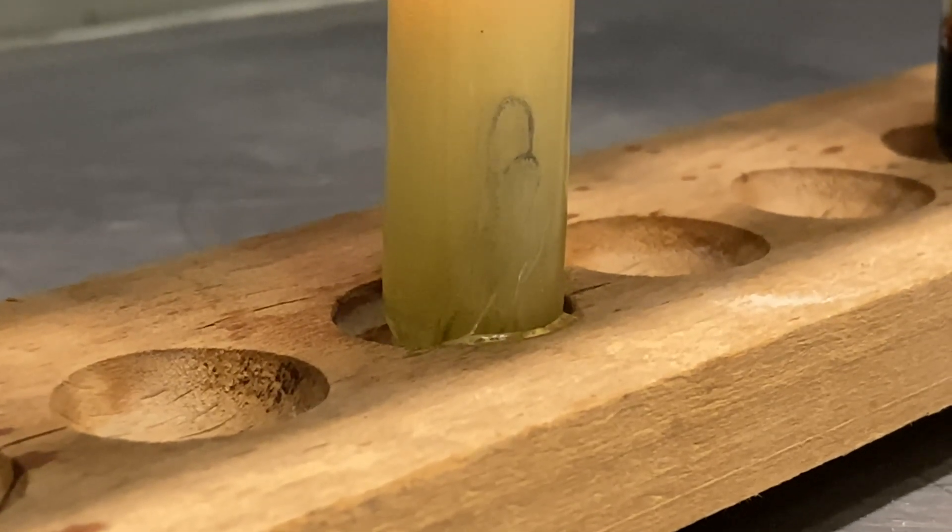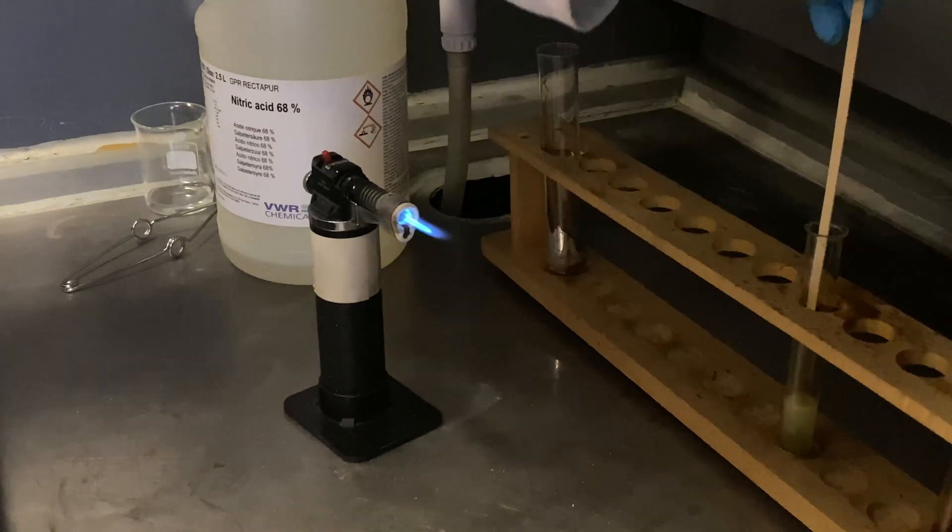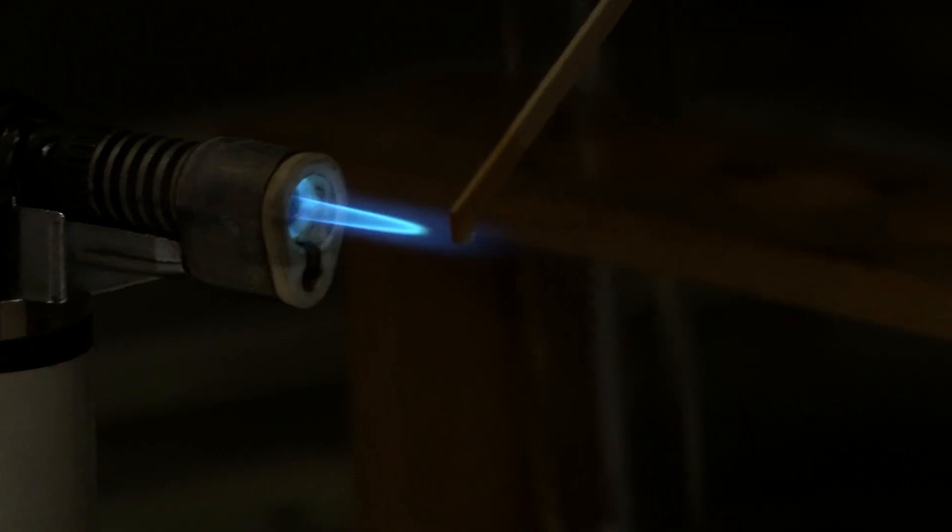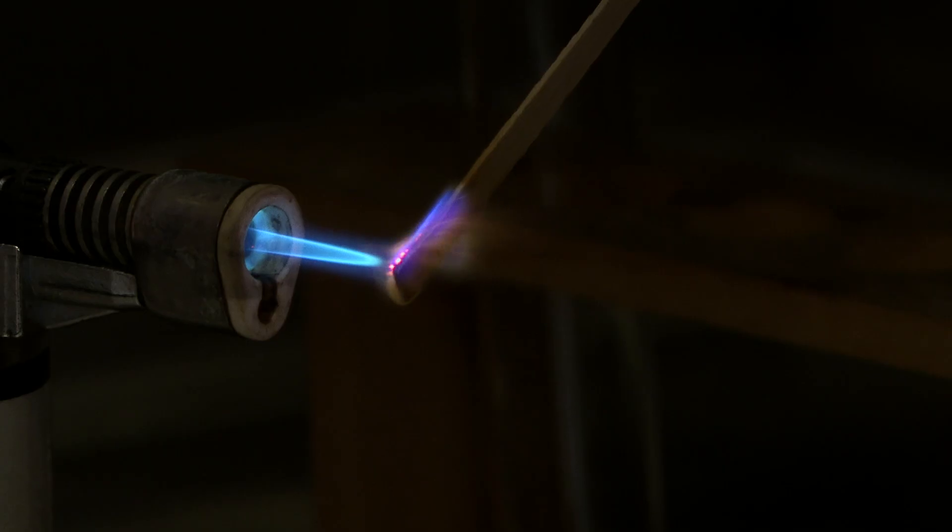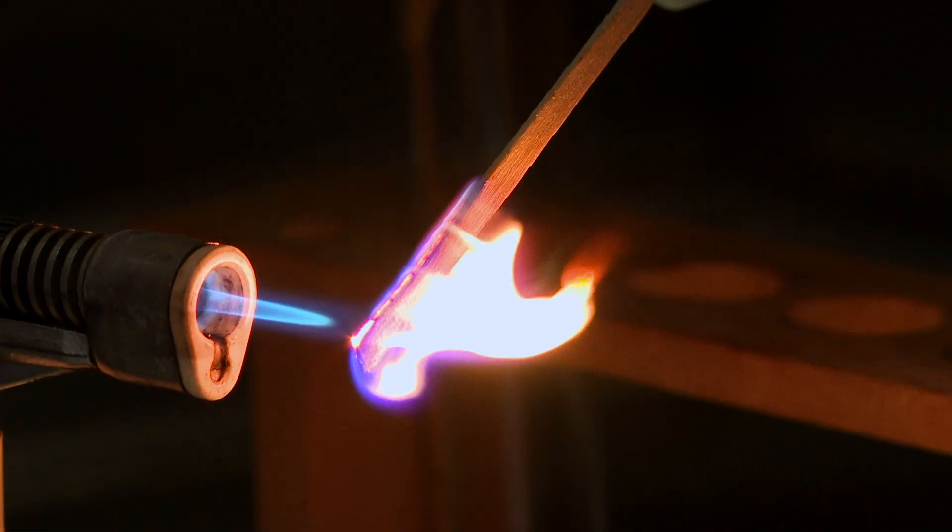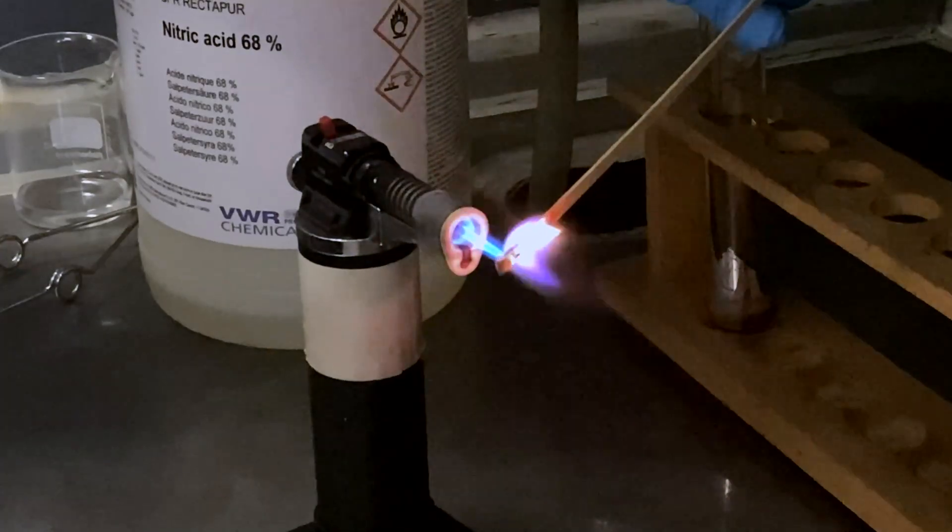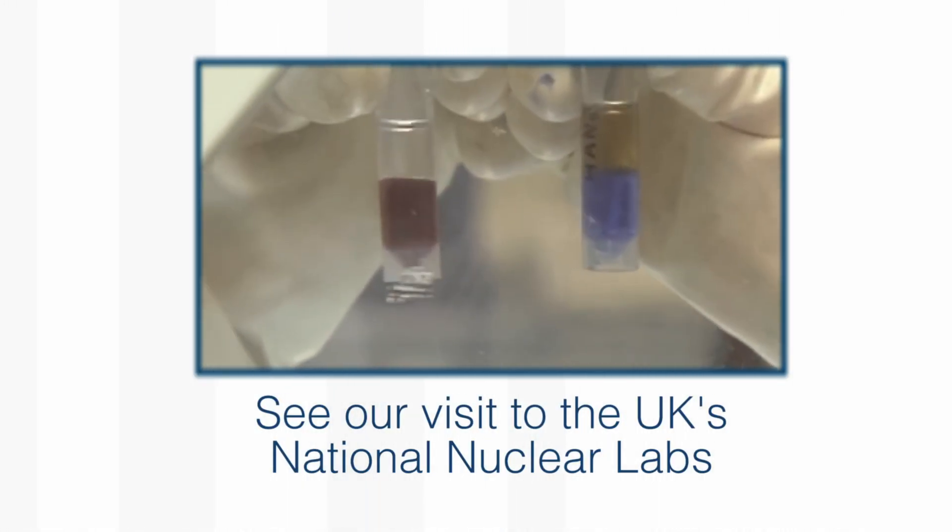We never isolated the indium nitrate but because I hadn't been there Neil thought he would try and show me the color again. This time he took some wooden splints, these are just very thin bits of wood and dipped it into the nitric acid solution which now contained indium ions and put that in the flame and you could see the nice indigo color. I'd never seen that before and so it was really quite an exciting first. I still think the purple color of plutonium three salts are nicer but we can't do plutonium in Neil's lab yet so indium is a good substitute.